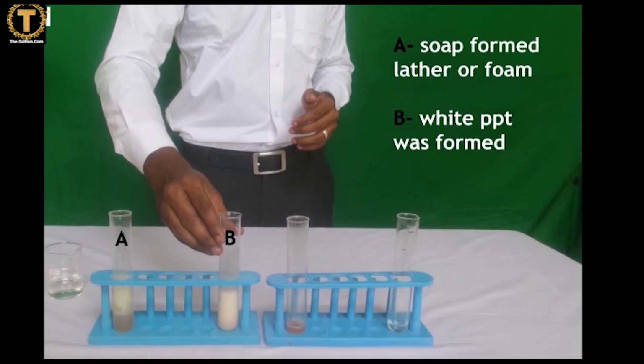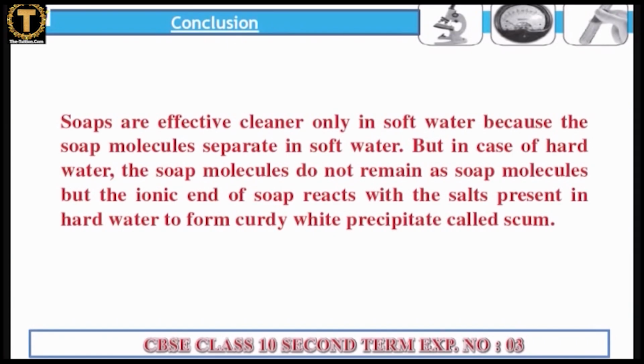Observations. In test tube A, soap formed lather or foam. In test tube B, white precipitate was formed with no lather or foam.